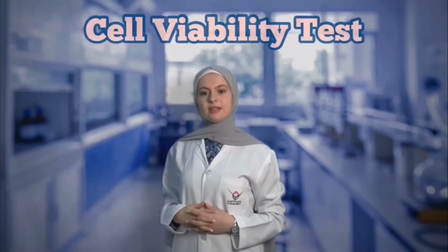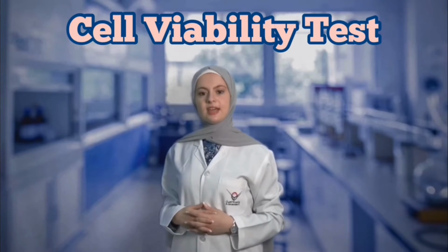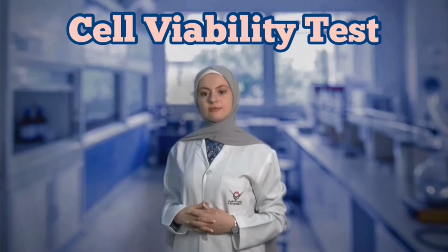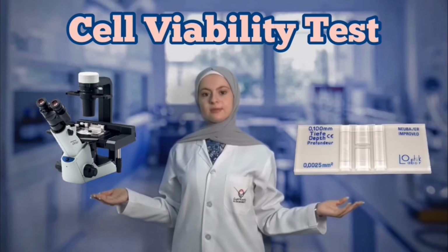For the cell viability test, cells were washed with PBS, then trypsin-EDTA was added to detach the cells in the incubator, which was set at 37 degrees Celsius and 5% carbon dioxide, for 3 to 5 minutes. After that, cells were counted using an inverted microscope and a hemocytometer.